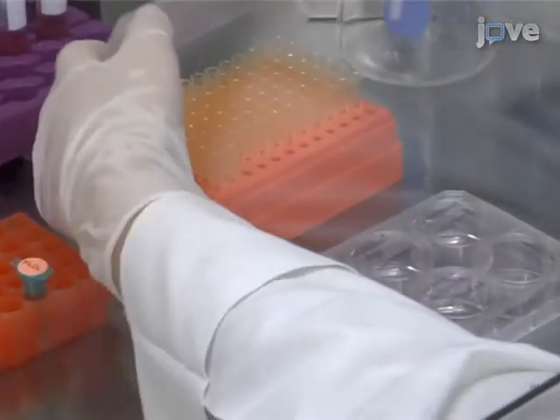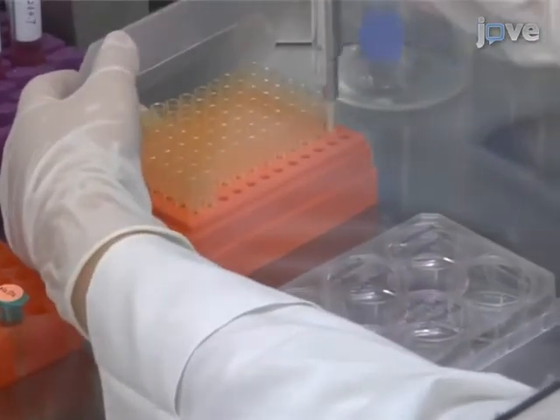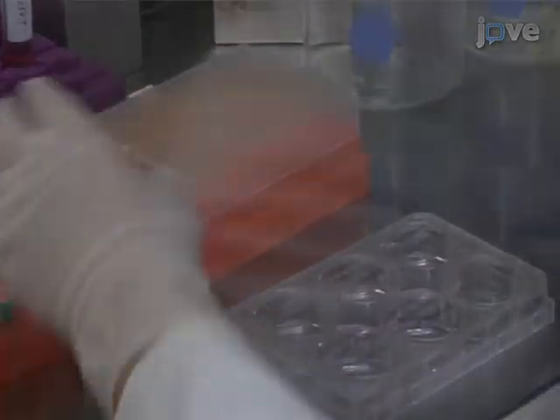Then, add fresh medium containing a drug of choice to the Carboxy H2-DCFDA loaded cells.